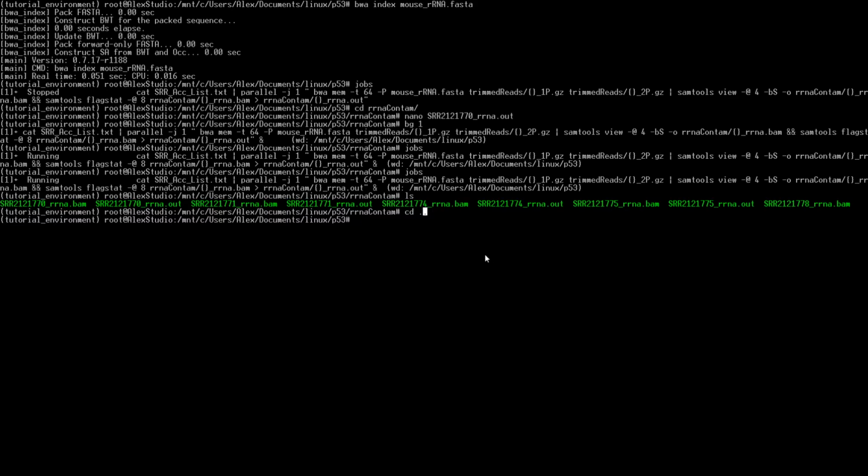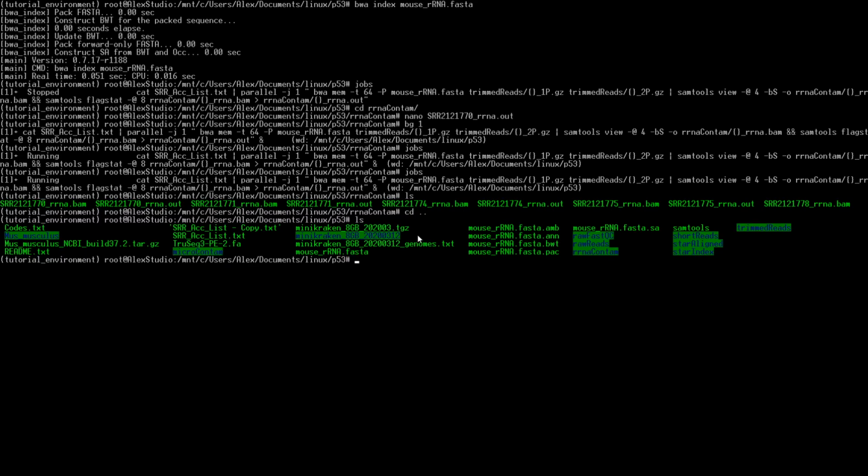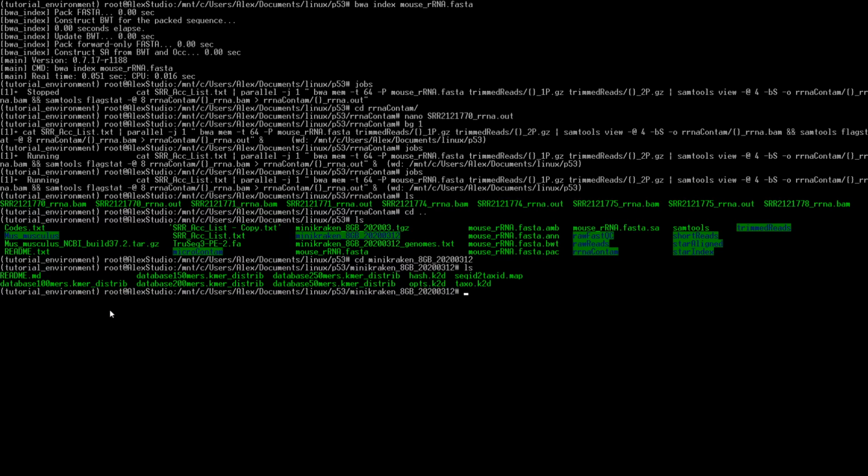Now, if we look at microbial contamination, we'll look with Kraken. So in here, we have our zipped file. If we do ls, we have the zipped file here. Go ahead and do tar, and then zxvf, and then paste in the file. What that's going to do is create this. If we go inside of here, here are all the files that were downloaded for the microbial database. So that's what Kraken 2 is going to use to map our reads to.